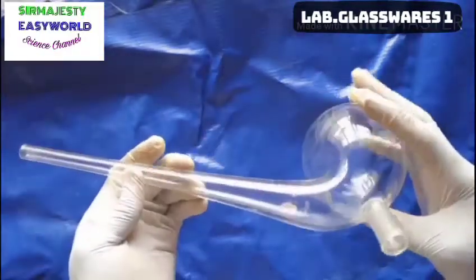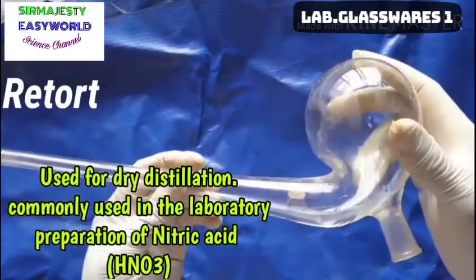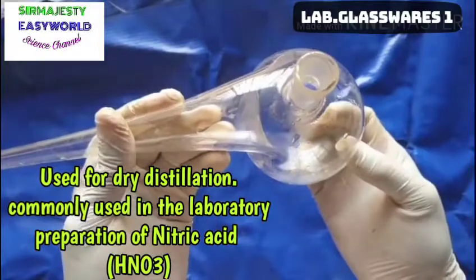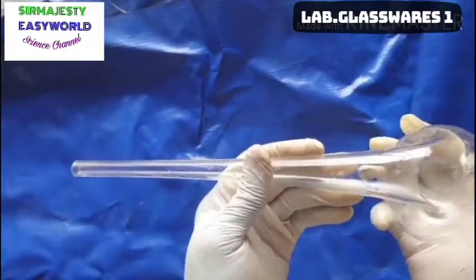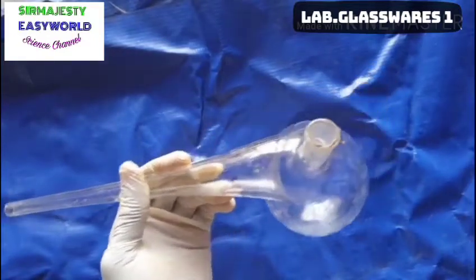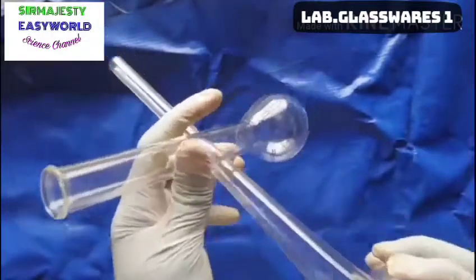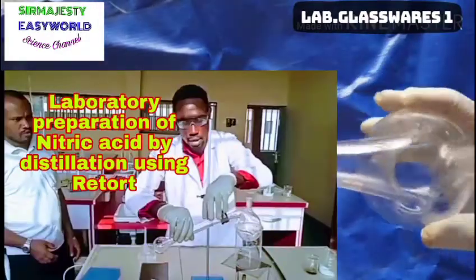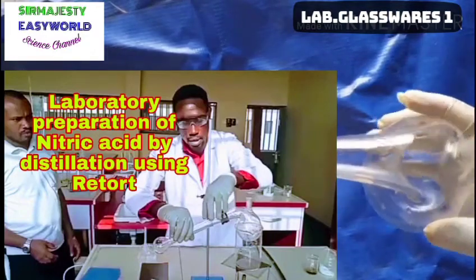Here is the retort flask, used for dry distillation — you can apply it for destructive distillation of coal. You put whatever you want to distill here, cover it, heat it, and the distillate comes out here. You can use a small round-bottom flask, sometimes called a Kjeldahl flask, to collect the distillate. Watch my video here on how to use the retort flask to produce concentrated HNO₃ — that's nitric acid.